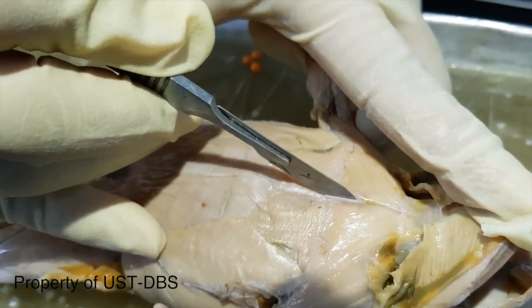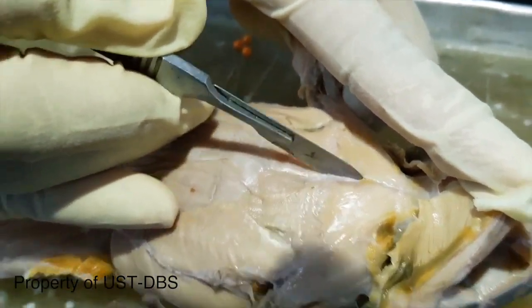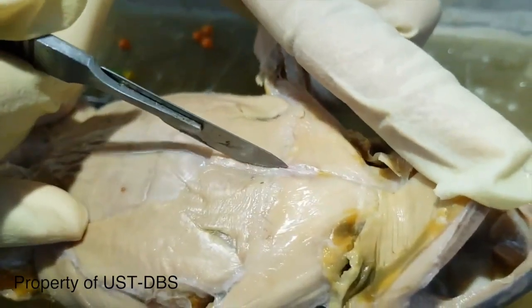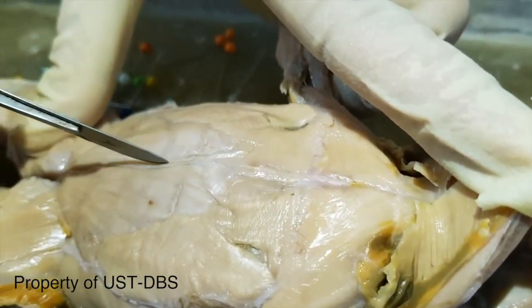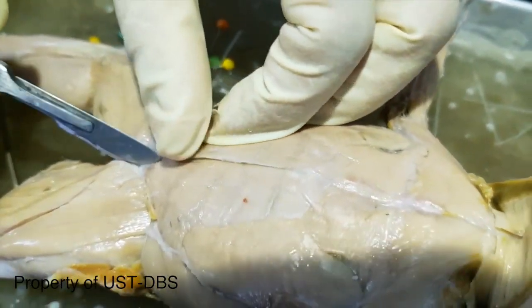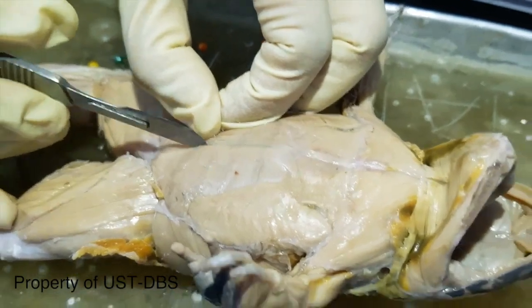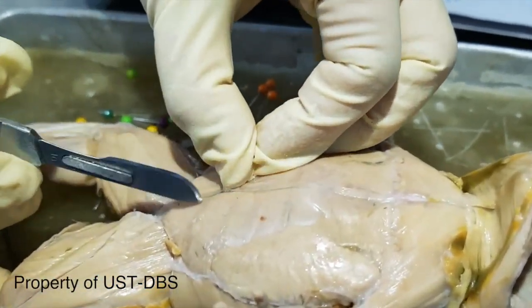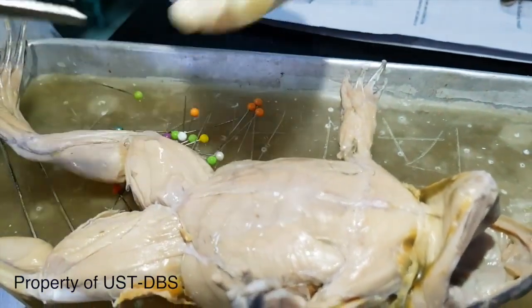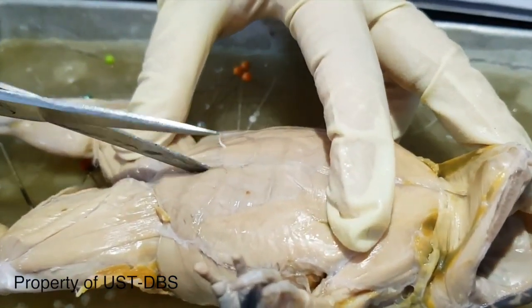At this area here, it's kind of difficult because of the presence of the sternum. So down towards the posterior region. You may use the scissors with the blunt end inside.